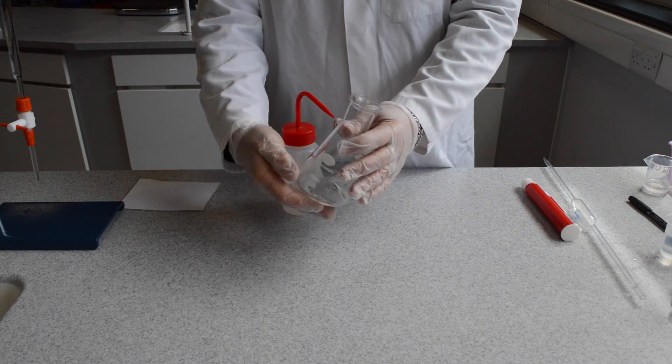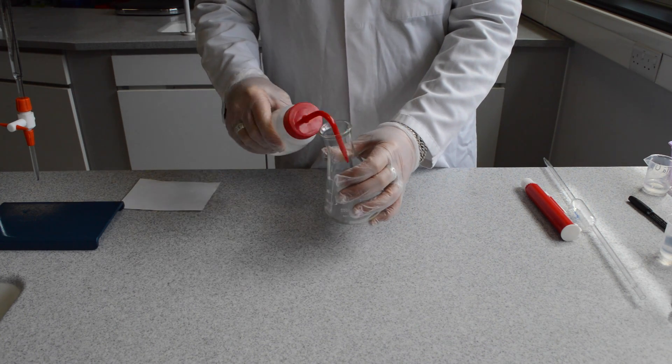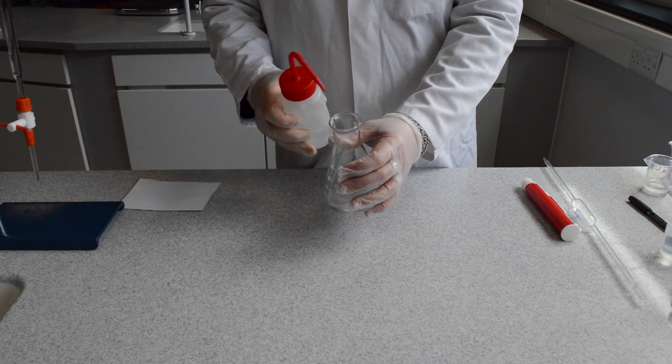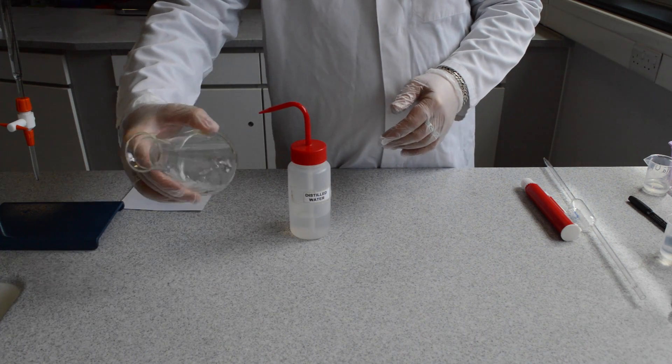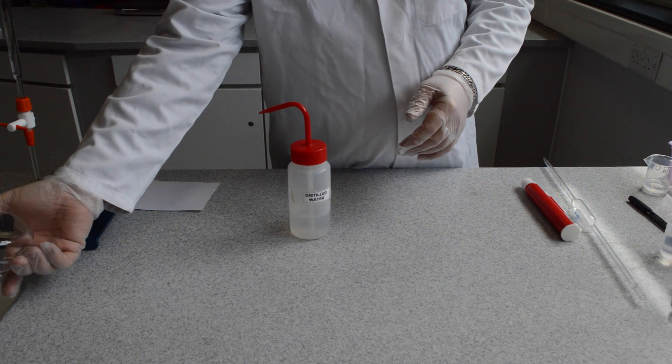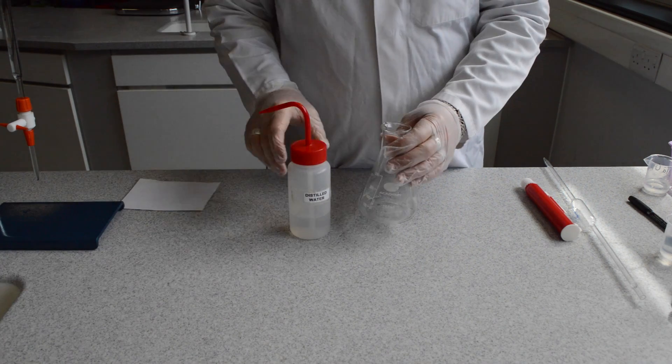Conditioning the conical flask does not require the use of any of the reagents within the titration. A simple rinse through will be sufficient. There is no need to dry the conical flask at this stage.